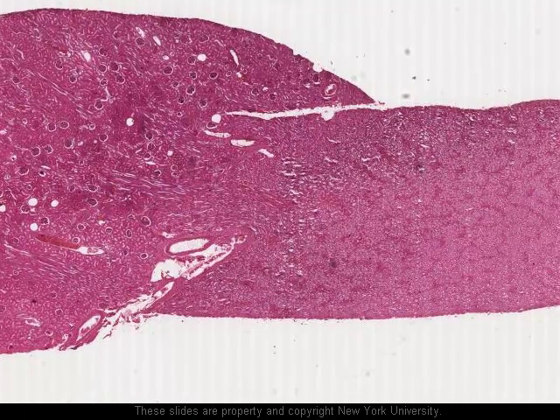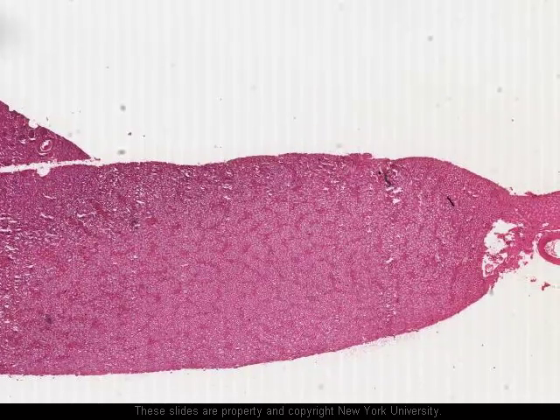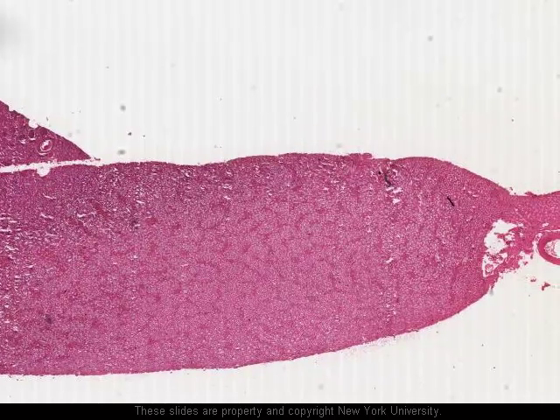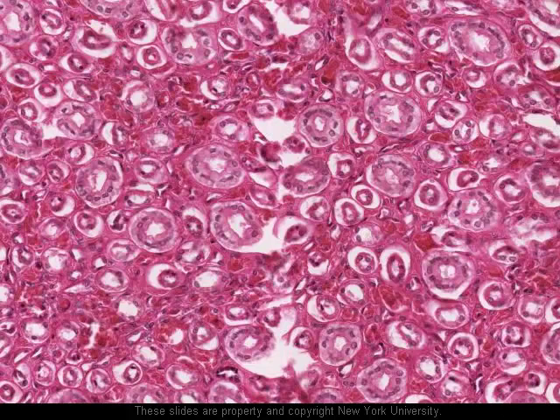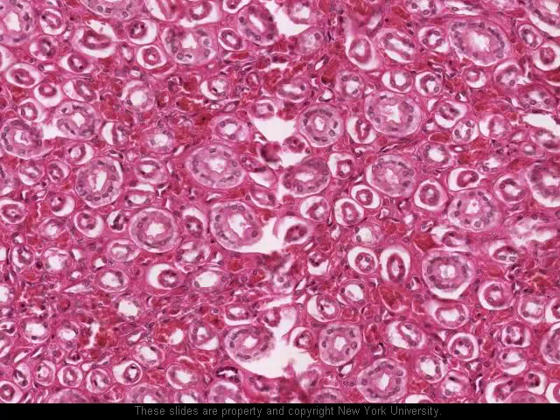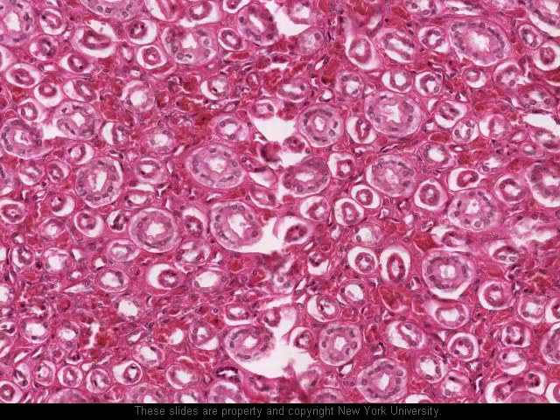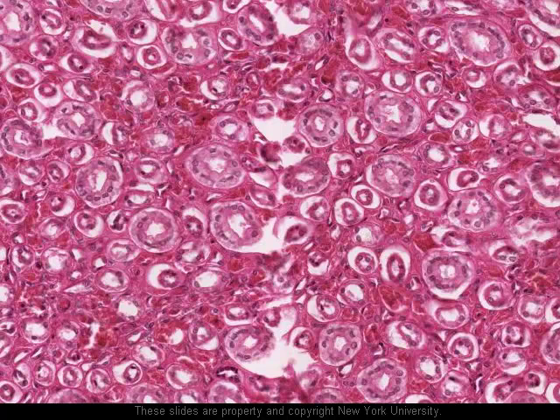Now we're going to look in the medulla. We'll simply move straight out to close to the tip of the medulla and take a look at what can be seen here — largely tubes caught in cross-section. Here we are out toward the tip of the medullary pyramid, looking at cross-sectional profiles of a variety of different types of tubes. The first and most obvious type are these ones here, lined by a tall cuboidal to columnar epithelium — these are the collecting ducts. It's the epithelium of the collecting ducts whose permeability to water can be controlled, and this control determines whether the urine which is excreted is isotonic, hypotonic, or hypertonic.